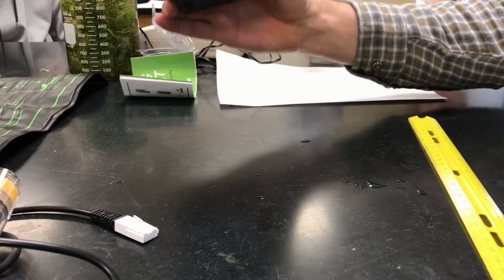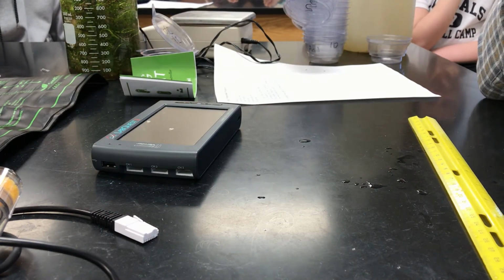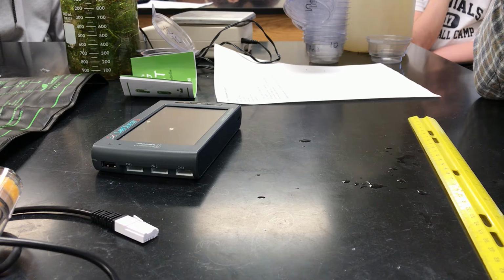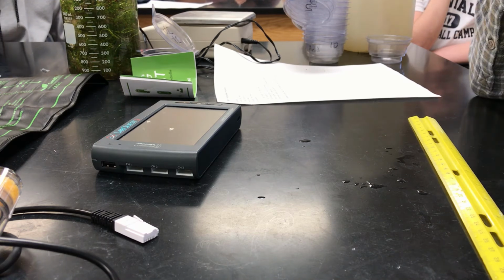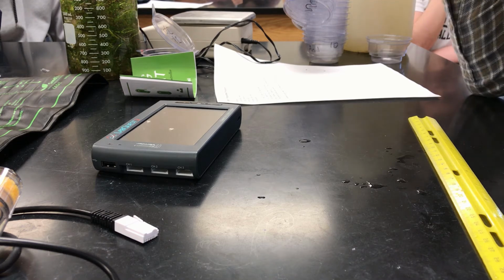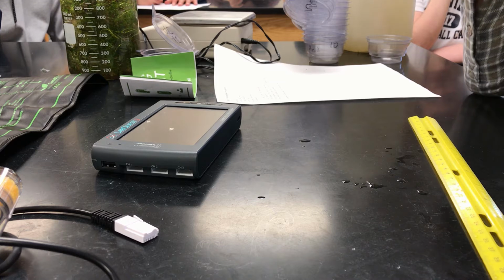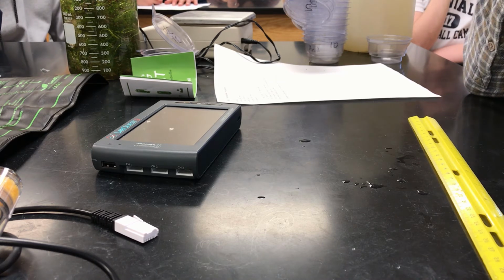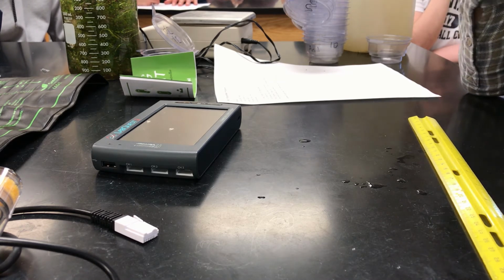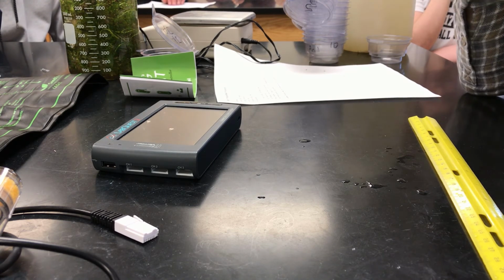All right, and then the next thing we have is our dissolved oxygen probe. So you will be using the LabQuests and the dissolved oxygen probe just like in the CER lab, and you will be recording the milligrams per liter of dissolved oxygen in your containers. You're going to want to do this a few times. So you're going to want to get day 0, and then get them over some amount of time. It's going to be up to you how many days you want to run that, and you want to do it on a fairly regular basis. Because we're starting so early, some groups could get set up as early as next week if you wanted to set some up.